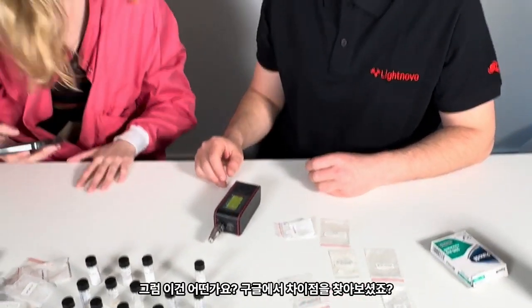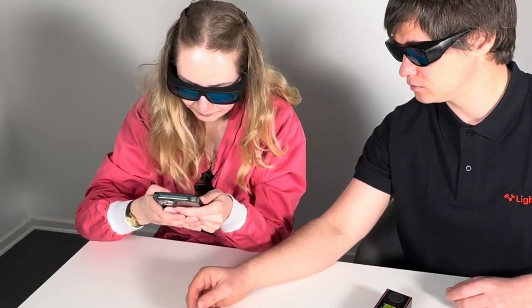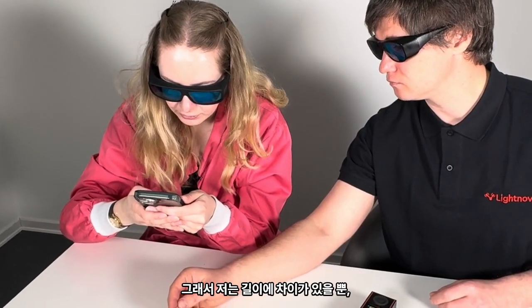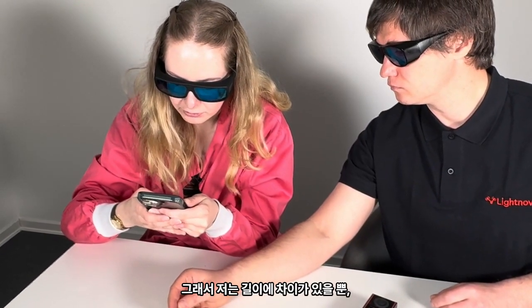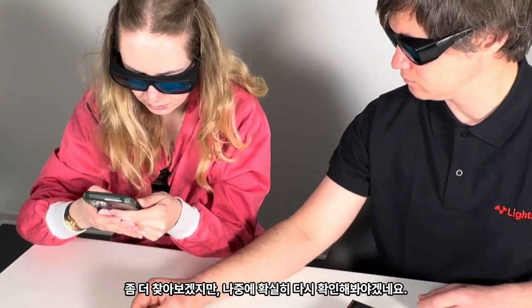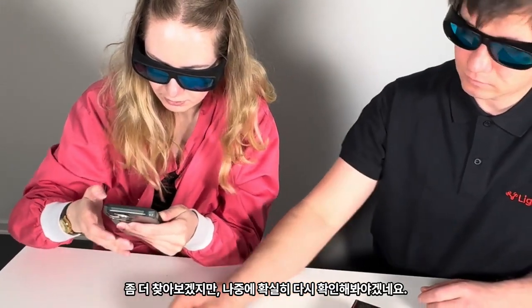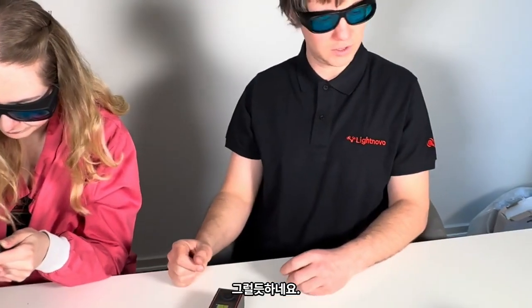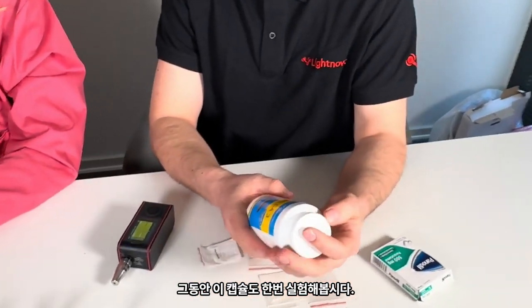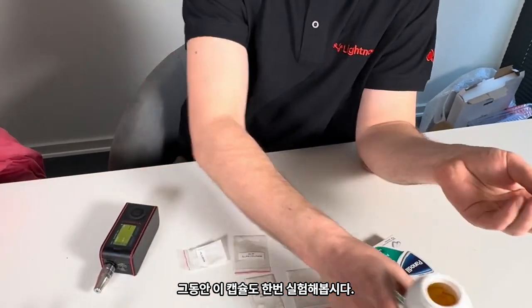So Vera, how about this one? You googled the difference? I think there should be just a difference in length, but the chemical composition is very much the same. Let me Google some more. Maybe I should definitely check later. Yeah, that makes sense. While Vera is checking, I want us to try this capsule.